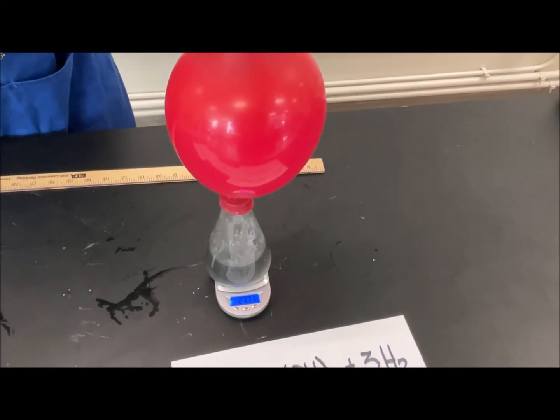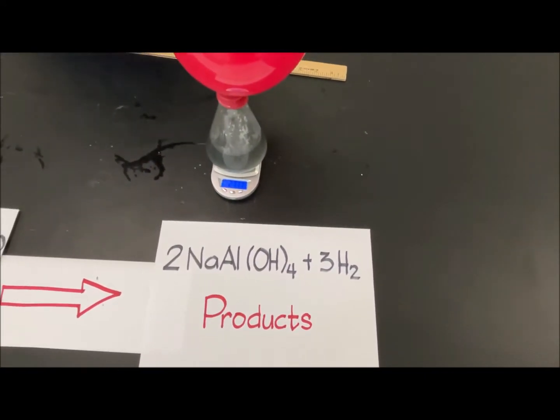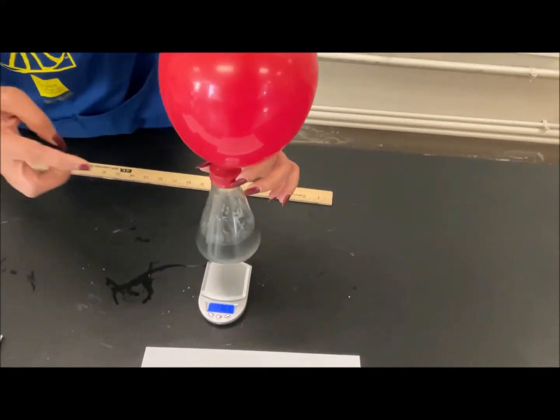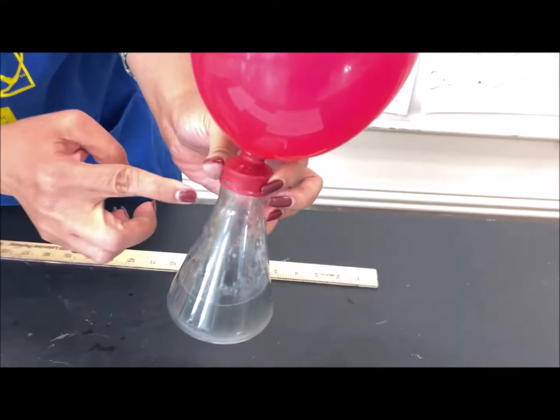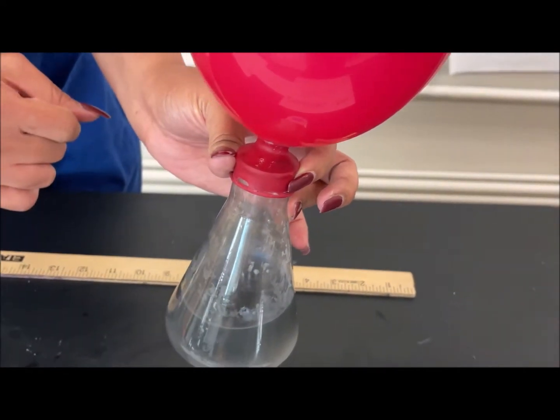So if you think about where did that mass go? Okay, they're supposed to be balanced, but if you look at the balloon's enclosure right here, it's not perfectly sealed. So there are gas molecules that have escaped this chemical reaction.